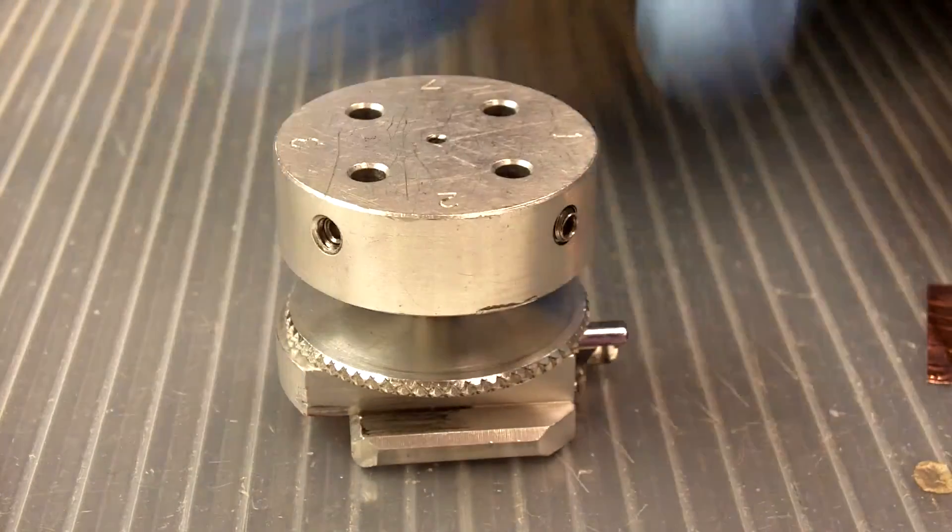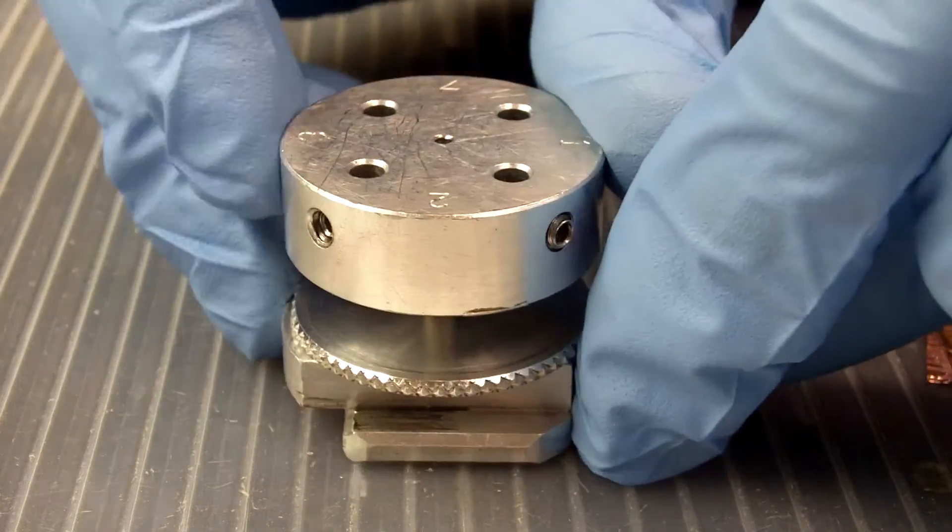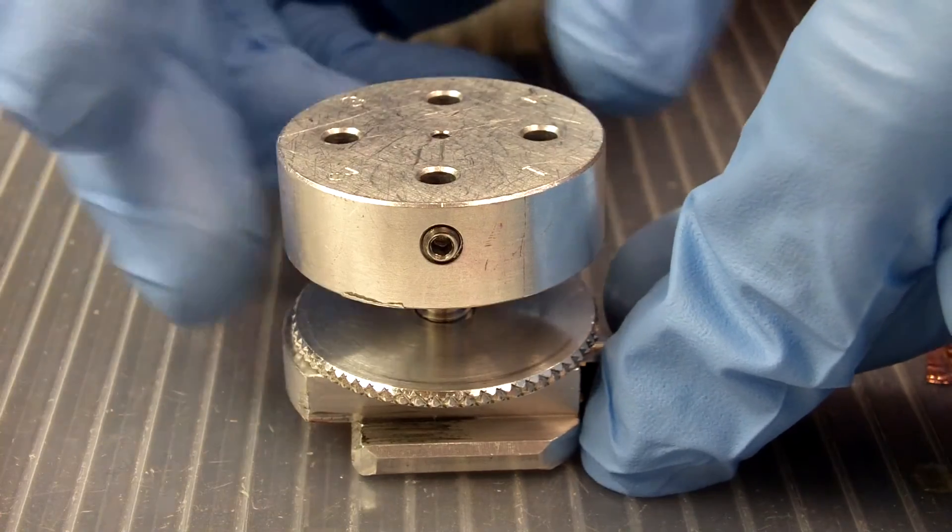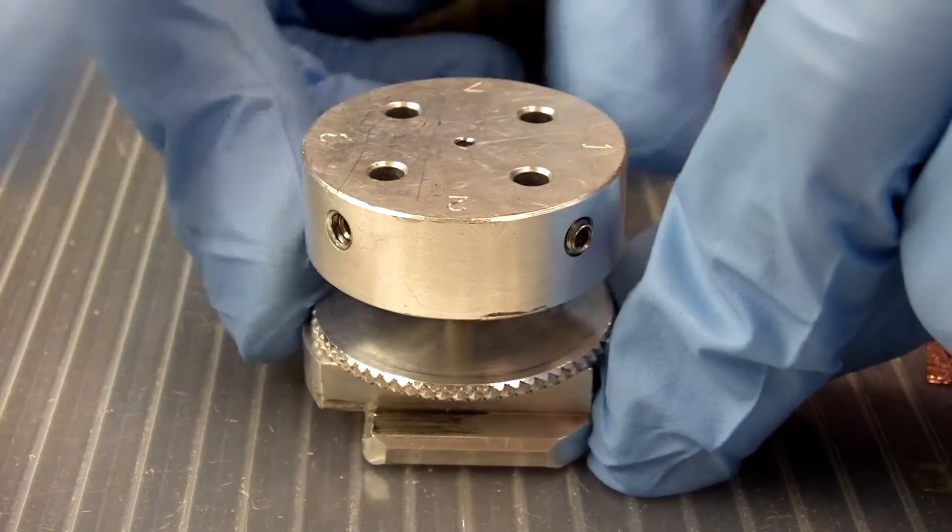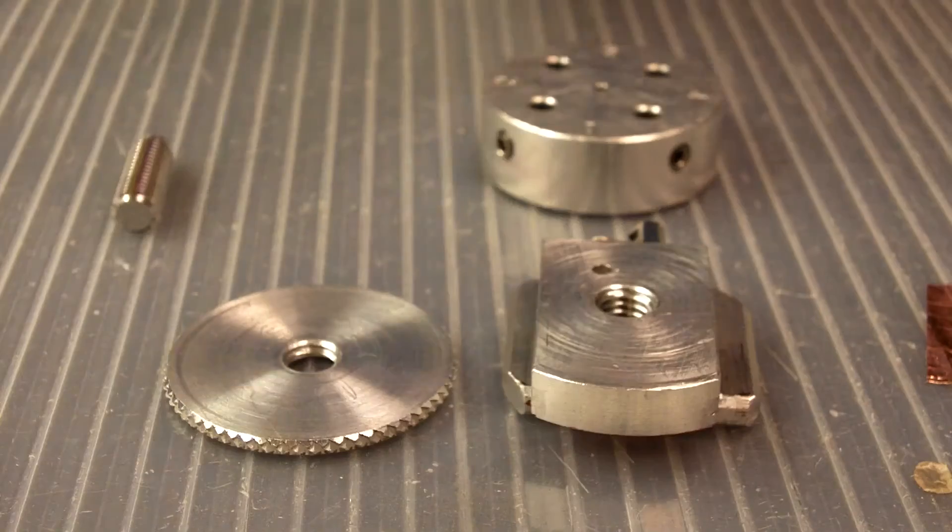See? It's not loose if I wiggle it around. But if I want to take it apart again, oh look, it comes apart very easily. That's it. About that tight. So one last time for everyone.